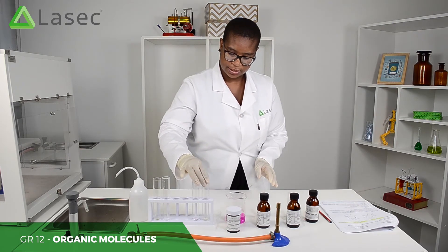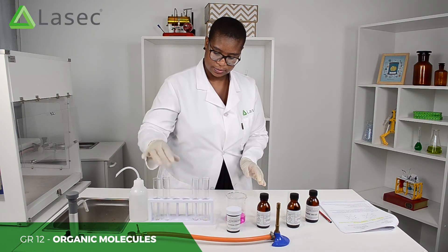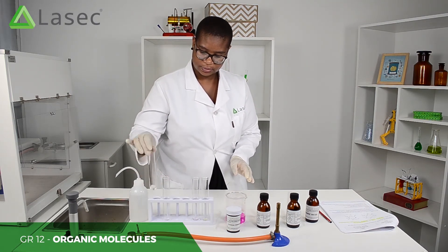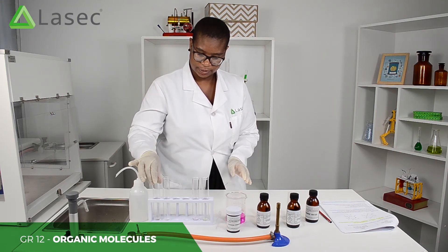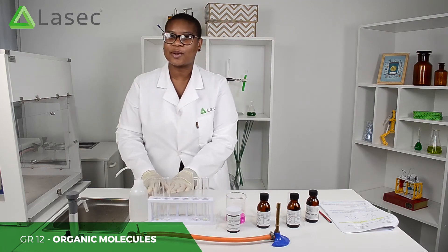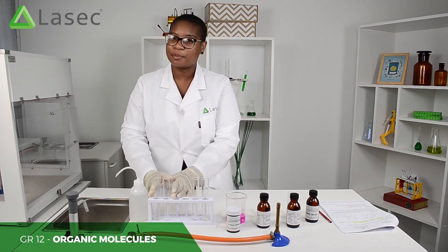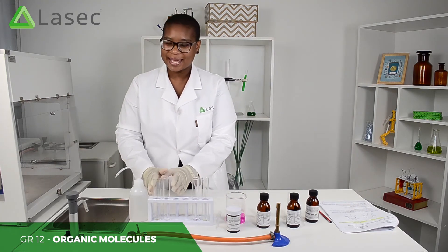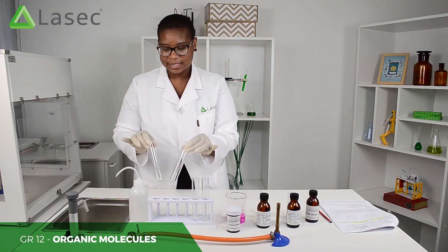Mix your reactions. Remember, this is cyclohexane and cyclohexene. Cyclohexene has double bonds and cyclohexane has single bonds. The double bonds in cyclohexene are easily broken.